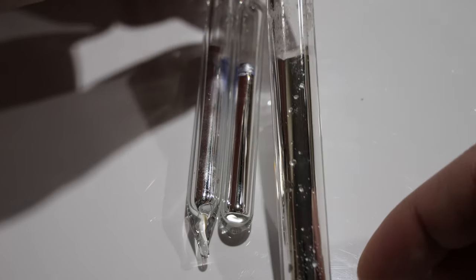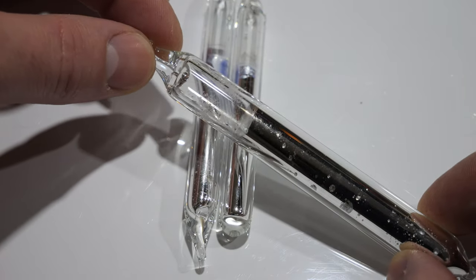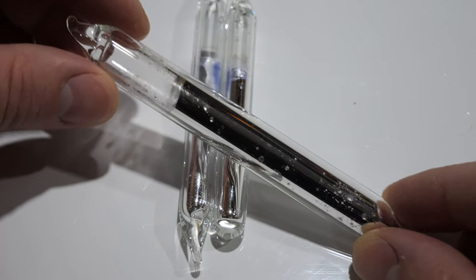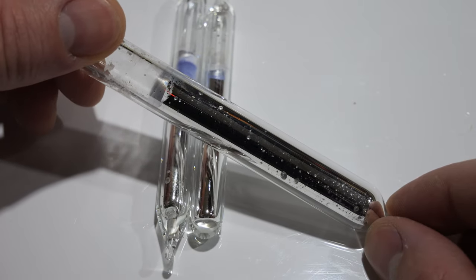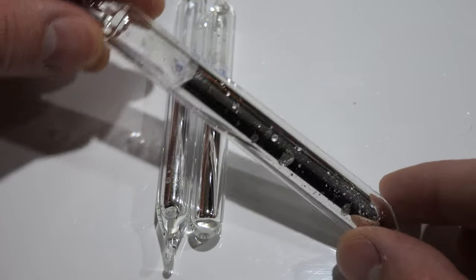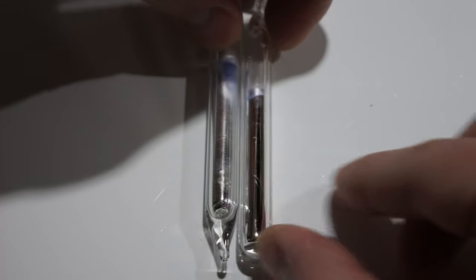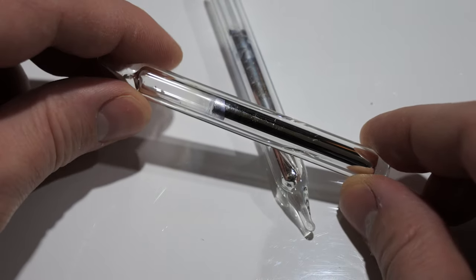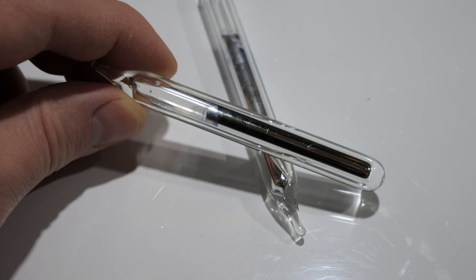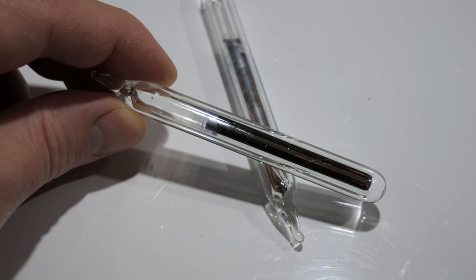As the title of the video suggests, if you are looking for a video on how to make pure potassium ampoules, I have to disappoint you. In this video, I will show you how to make sorta clean potassium ampoules. It was my first attempt, and as it happens, the first attempt is never perfect. Still, I thought I would let you in on my learning process and show you my failures as well.